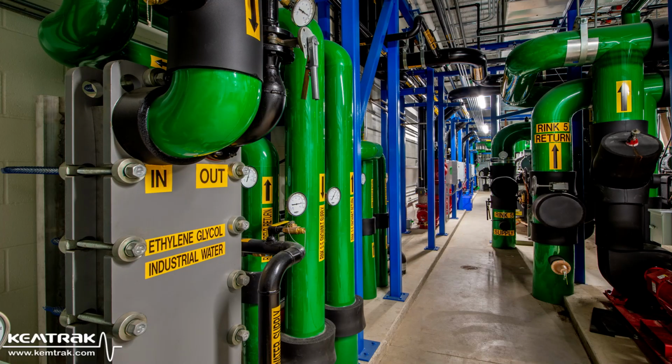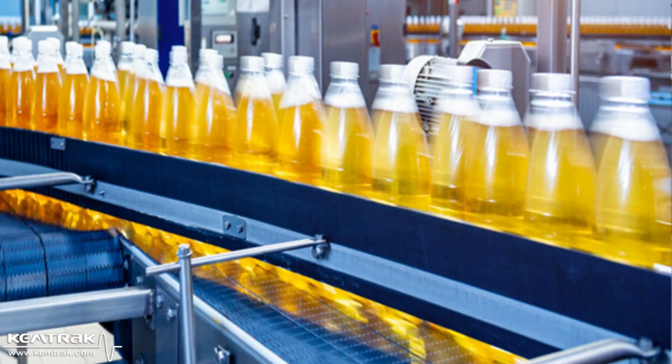In industrial processes, heat exchangers are often used to control temperature by transferring heat between different process streams. However, leaks can lead to contaminations where one fluid mixes with another. A common heat transfer fluid in food and pharmaceutical processes is ethylene glycol. However, ethylene glycol is extremely toxic, and a leak can have devastating effects on both human health and your brand's reputation. Often, product contamination is only detected in the lab after the product has already left the facility, sometimes even after it has reached the customer.